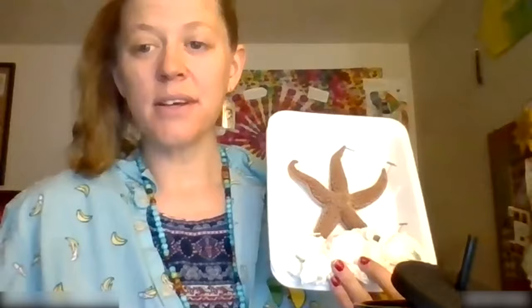You guys can just unmute and talk, or put it in the chat. They can regrow their limbs. Yes, okay. It has arms. I know it has to walk on a flat surface. It has a mouth — is it in the center? Yeah, it's in the center. Yes.